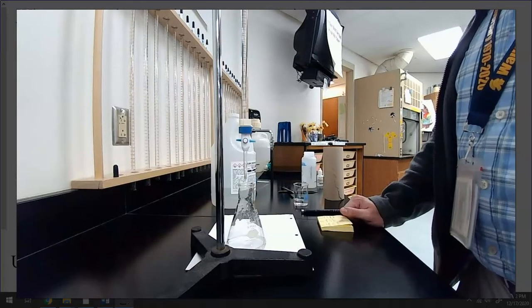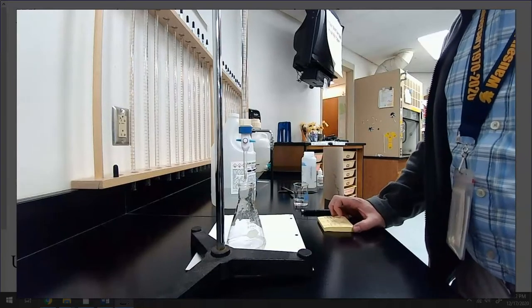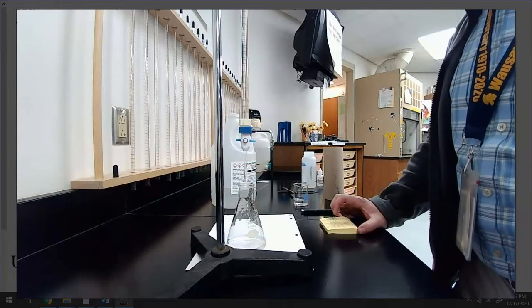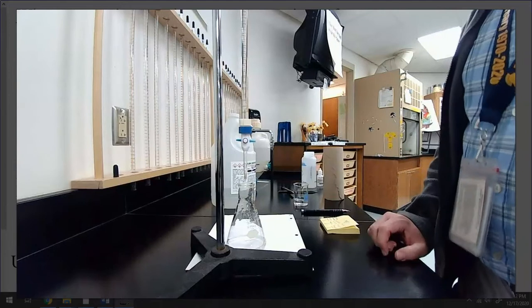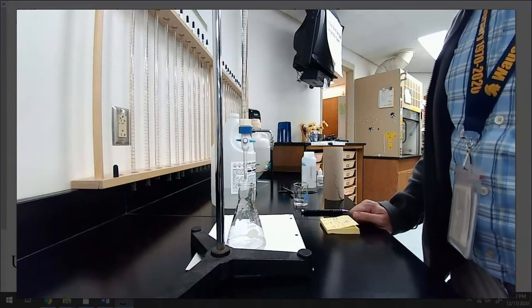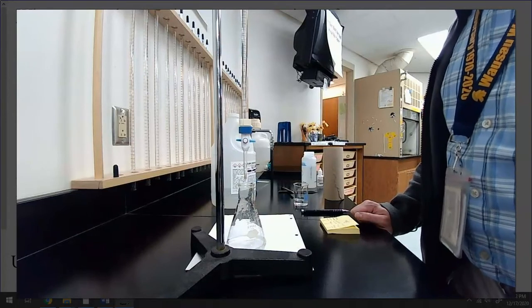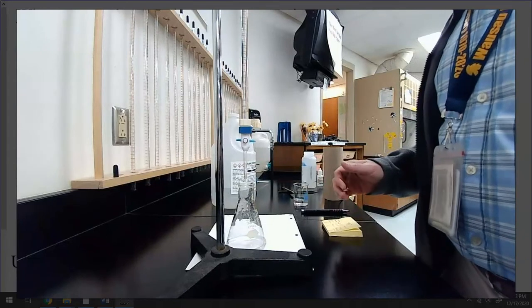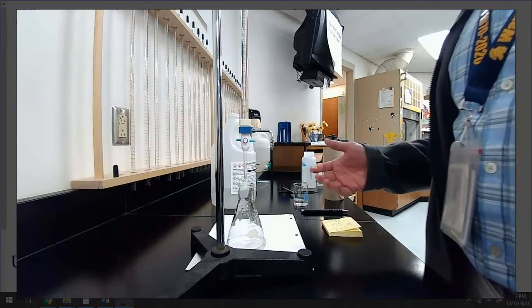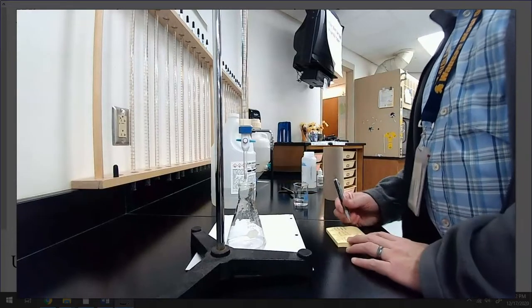Okay, here we go. Trial 2 for unknown acid B. I have 0.609 grams. That's more than I wanted, but again, it doesn't really matter. I just know now if 0.521 grams of unknown B required around 20 milliliters, if I have 0.609 grams, I know it's going to take over 20, right? So I can be a little reckless here because I know it needs at least 20, right? Just mathematically speaking.